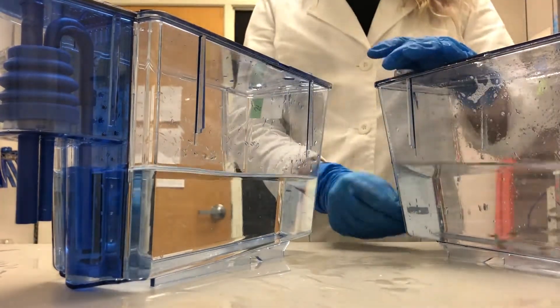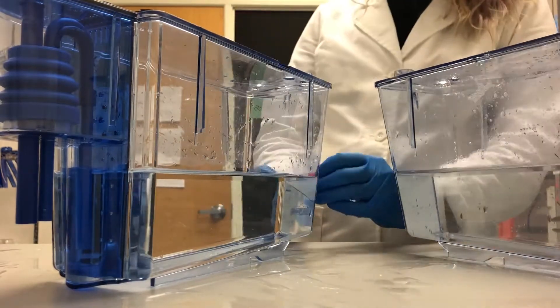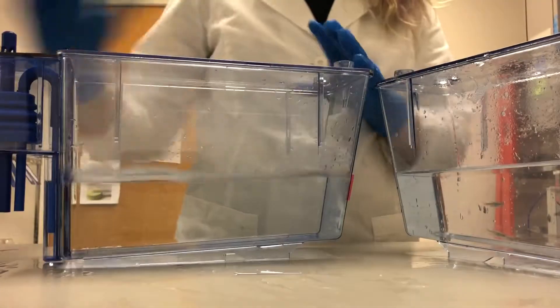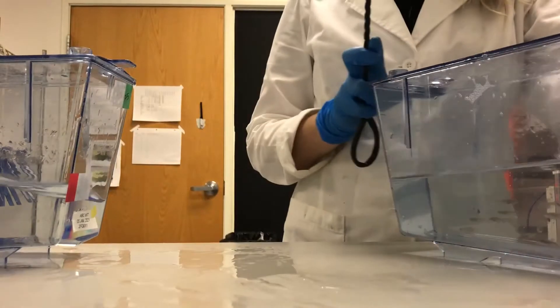We make sure to transfer all of the important labels from the old tank to the new tank and then we can start transferring the fish over.